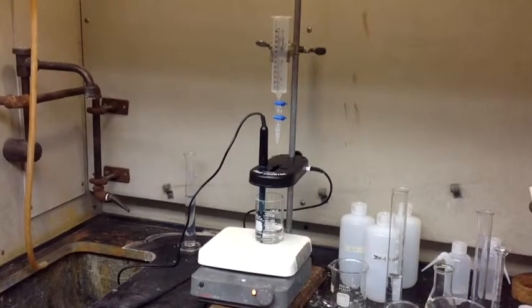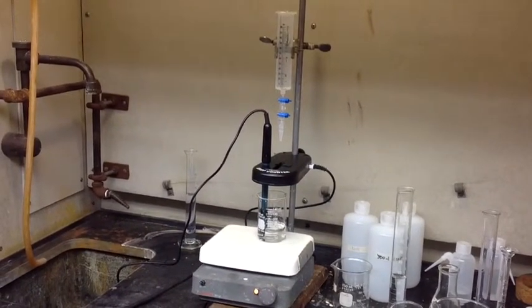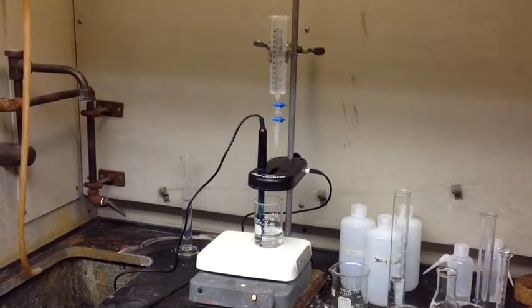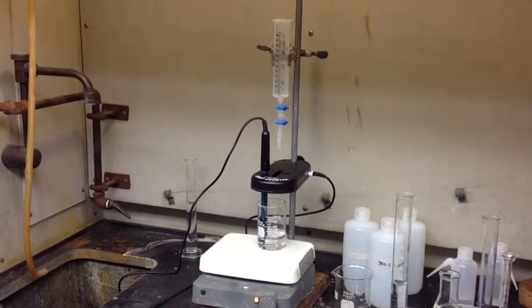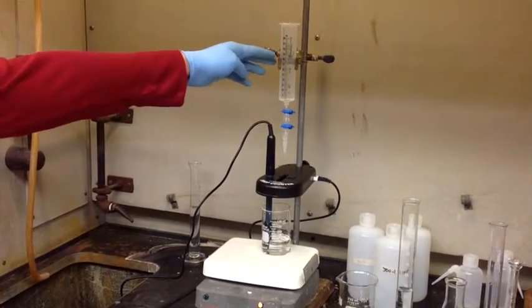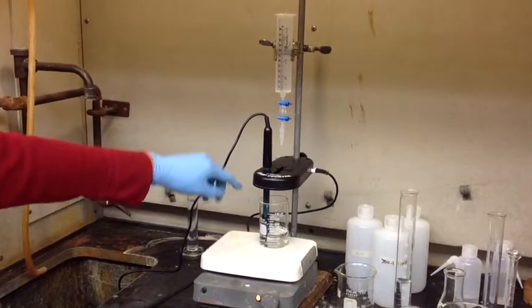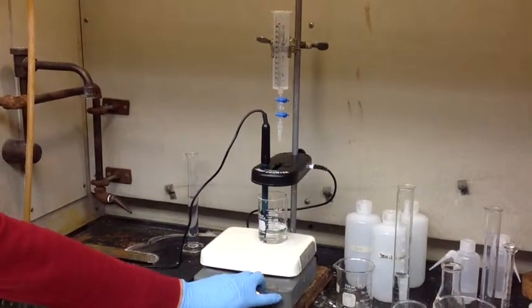So you're first going to rinse out the reagent reservoir with the NaOH solution, set up the drop counter, calibrate the drop counter, add the pH meter, measure out 50 milliliters of the acetic acid solution and pour it into the beaker, and place the beaker underneath the drop counter and the reagent reservoir. Fill the reagent reservoir full of the NaOH solution and make sure that the drip will still go down through the slit in the drop counter. Put the stir bar in the beaker and turn on the stir plate.